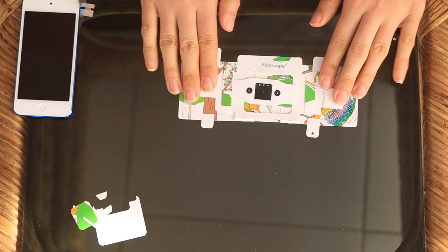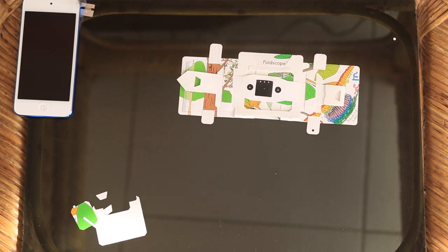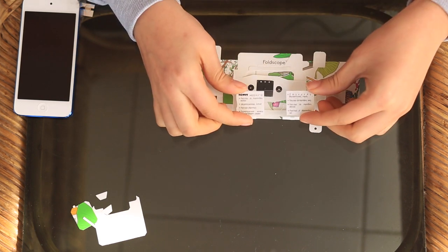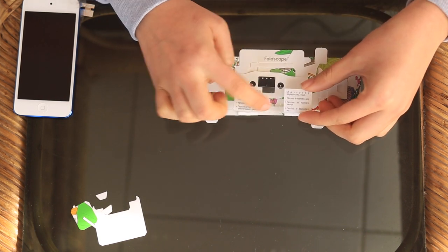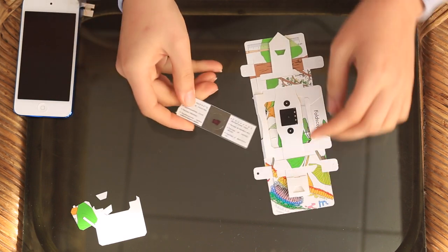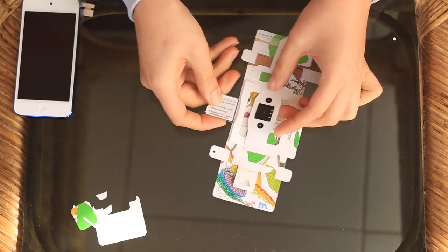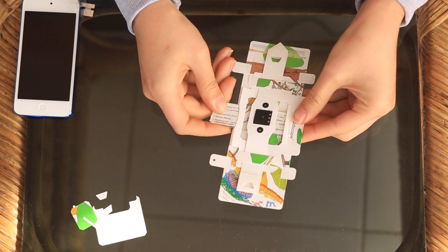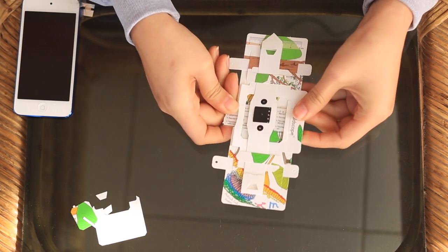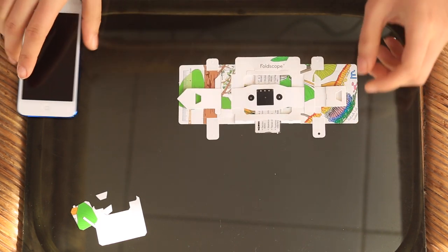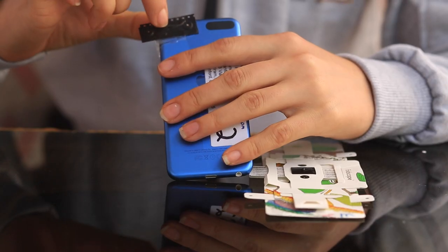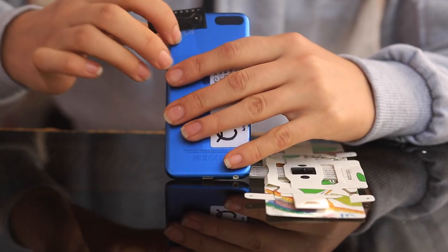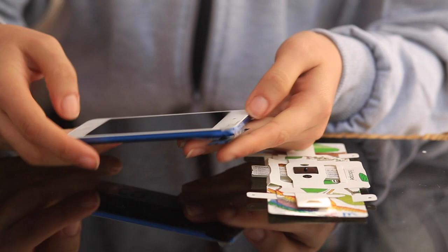The last thing that you can do is if you take a slide, so this is a piece of pancreas, you take your sample, you put it under here and through to there. What you do is you take your smartphone and there's another magnetic coupler. So it's on your smartphone.